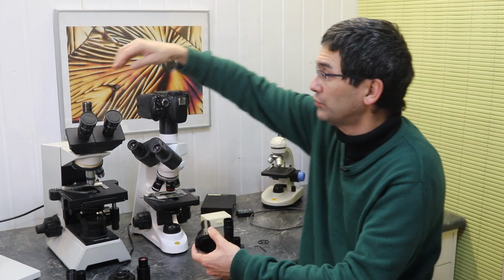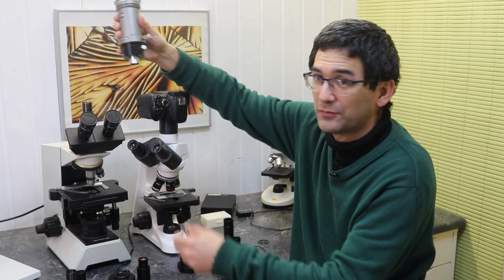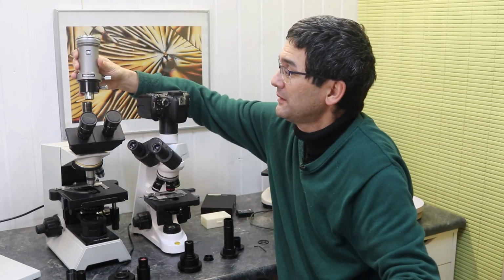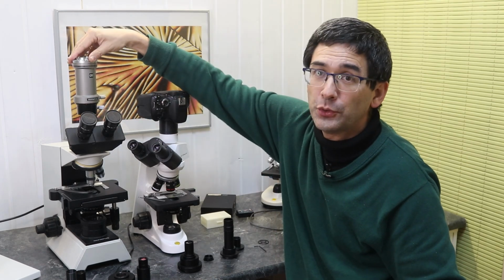Just want to show you also the original solution of the Olympus microscope here. Look at this. This is the original solution here. There is also a photo projection eyepiece. Yeah, it's huge, and then I can connect the camera on top here.